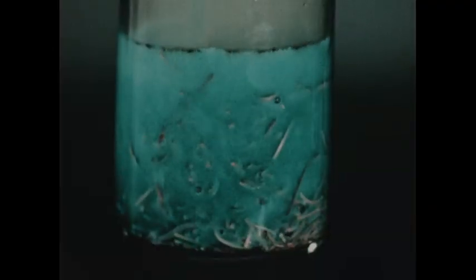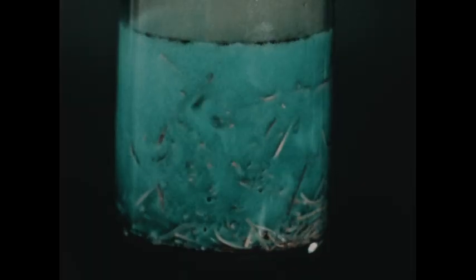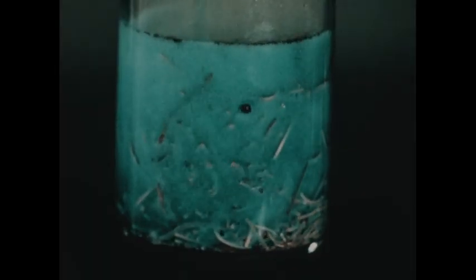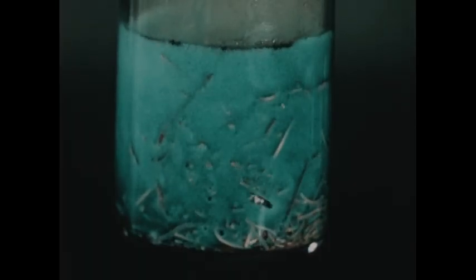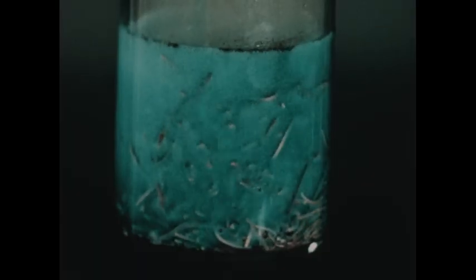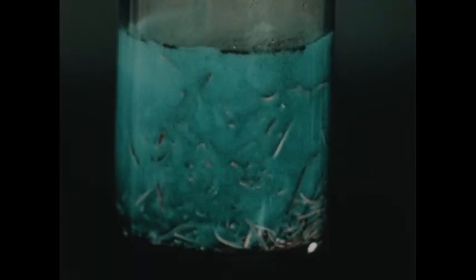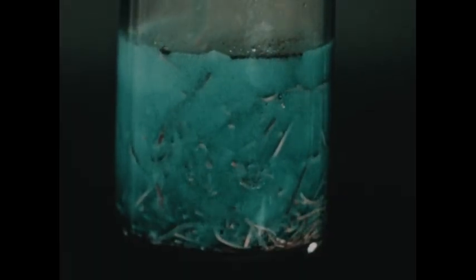In this close-up shot of the generator bottle, you can see the bubbles of nitric oxide rising from the copper. You should note that the gas above the liquid in the bottle is nearly colorless, indicating that the brown oxide of nitrogen, NO2, is not being produced in any substantial quantity by this reaction.